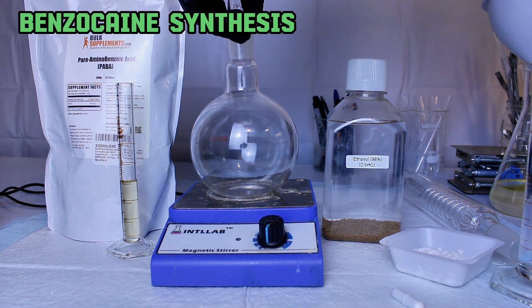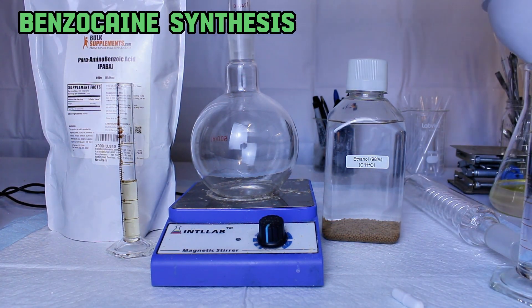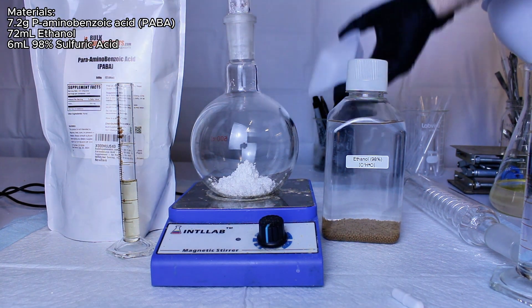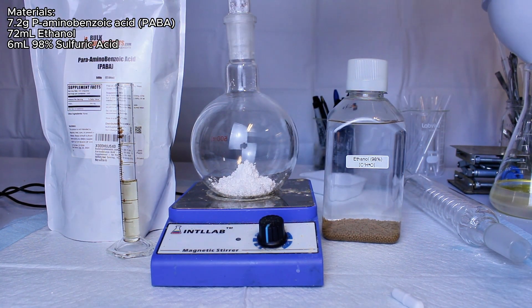Benzocaine is a topical anesthetic that finds a wide variety of uses in medicine, and today I'm going to make some. This process is actually pretty easy, and you really only need three ingredients.